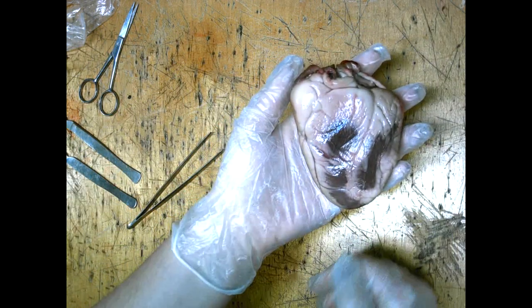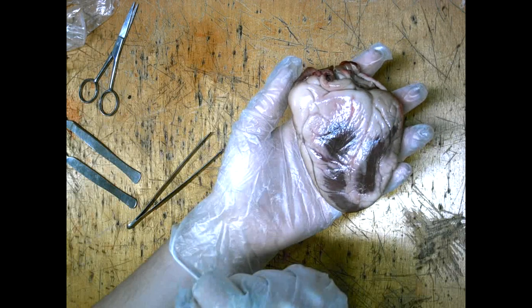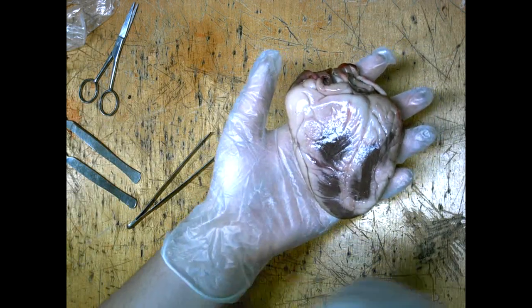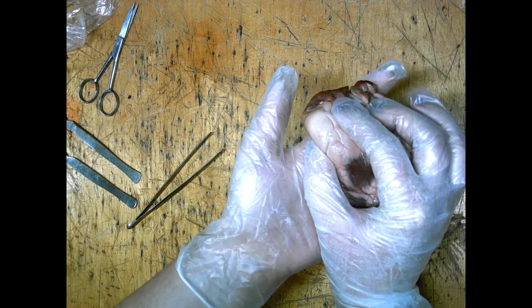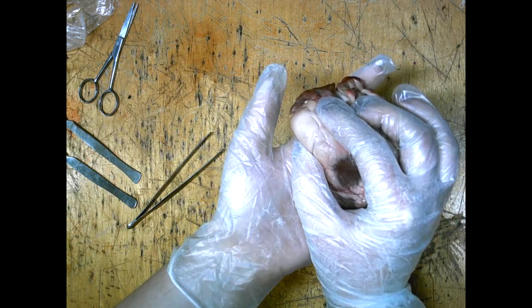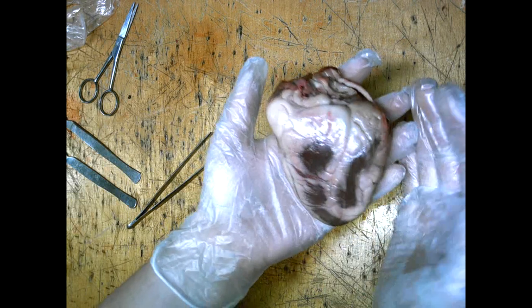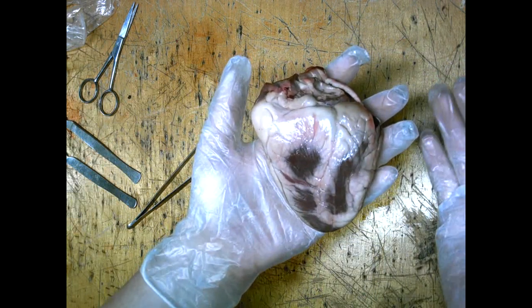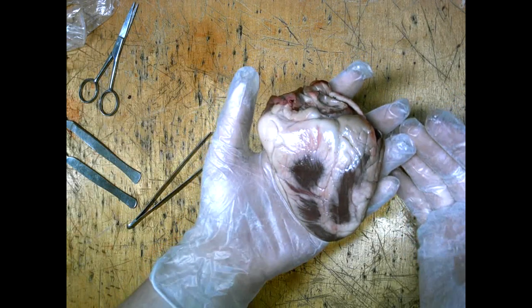The brown and white deposits that can be seen around the heart are fat that has deposited. The fat is very, very hard and this restricts the ability of the heart to pump blood. The more weight you put on, the more fat that is deposited and the harder the heart muscle has to work.